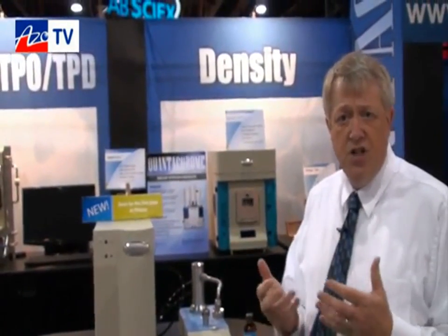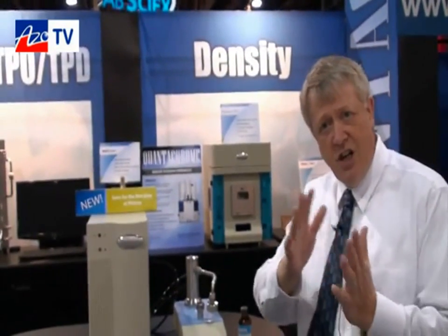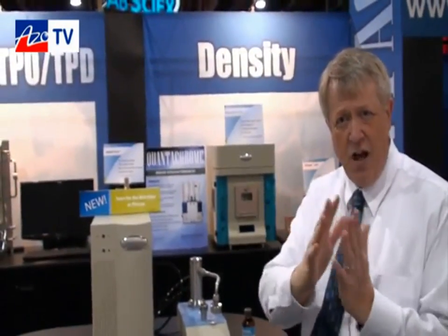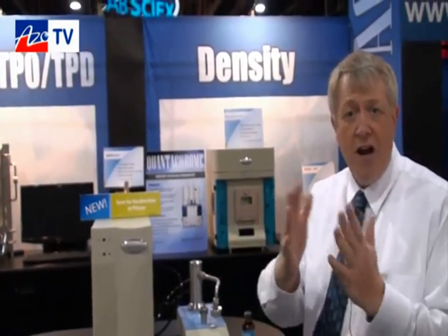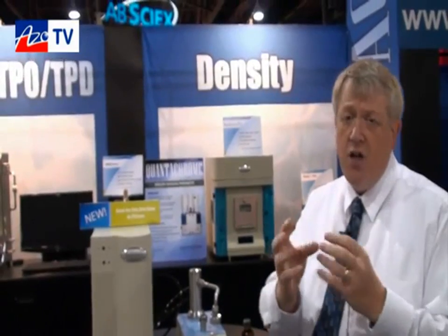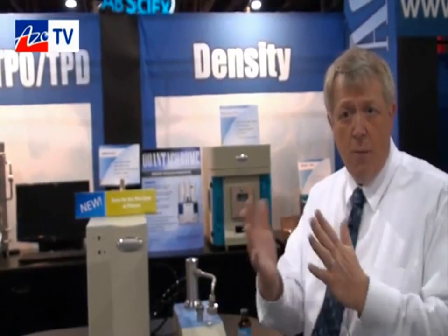For example, battery separators, these non-woven polymeric materials, generally, you've got to make sure that those battery separators can allow proper exchange of electrolyte through there, but not allow solids to migrate through that separator. So you've got to make sure that there are no large holes, and even that the strength of the membrane type material or textured fabric can actually withstand a certain pressure differential across that membrane.